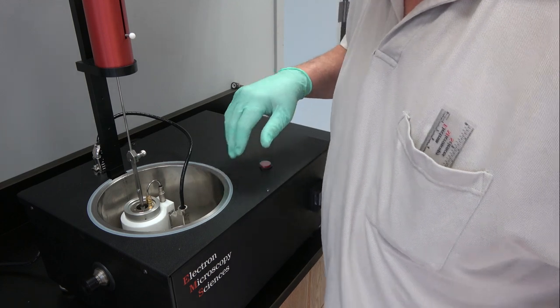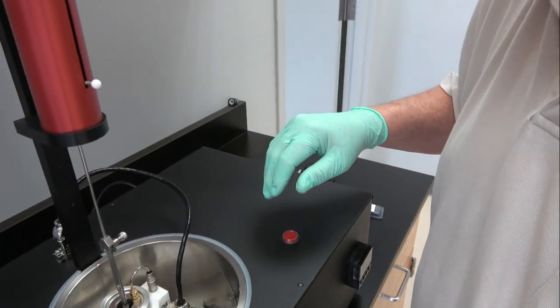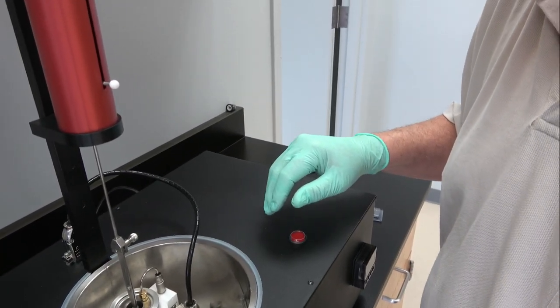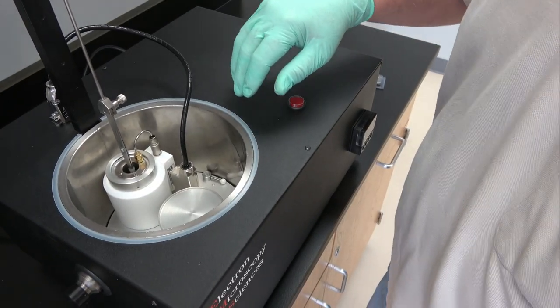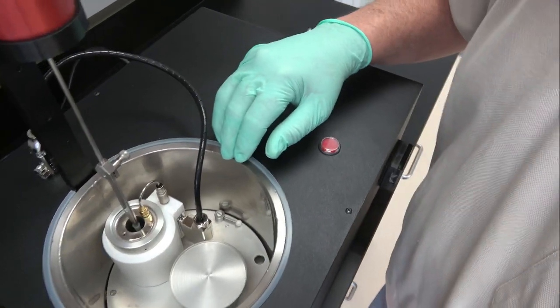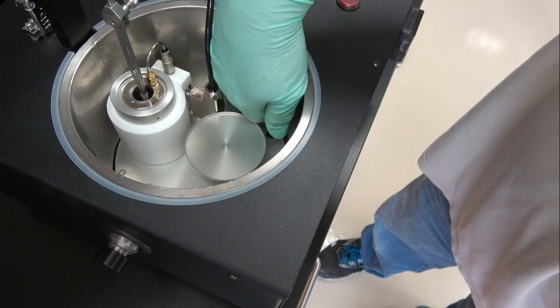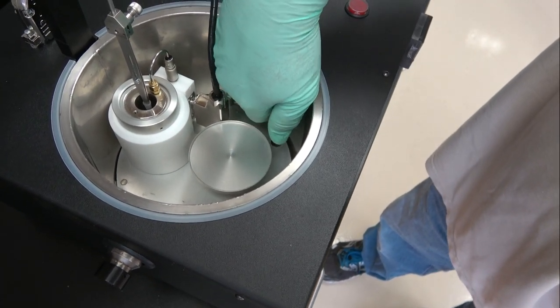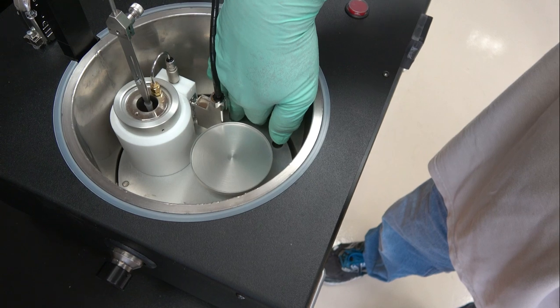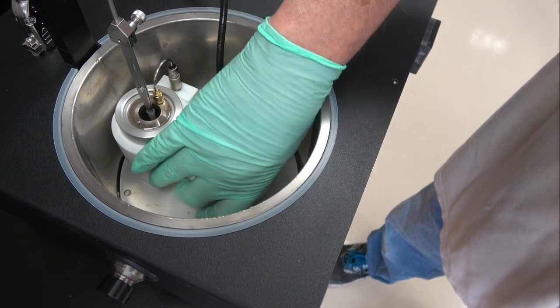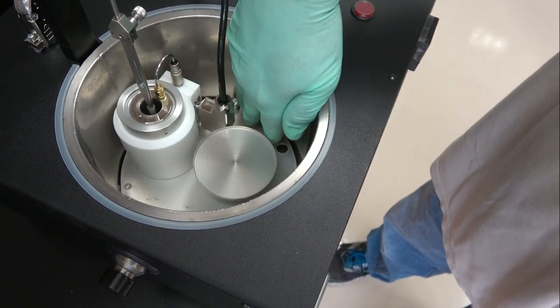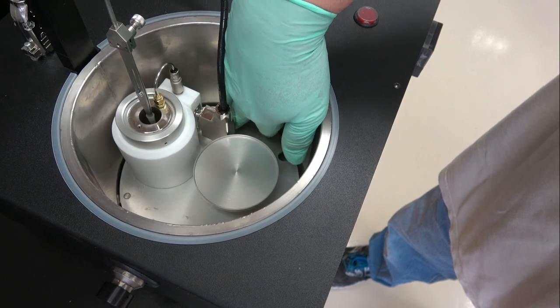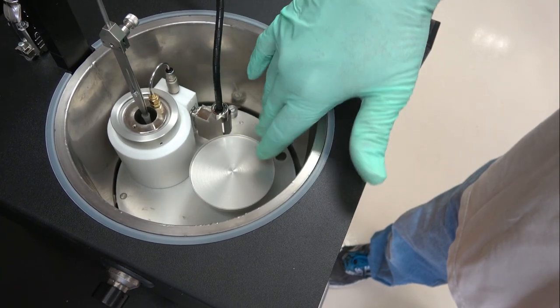Then a little tough to see, I'll try to maneuver the camera so you can see. There is a little locking cam over here which you can maneuver with your fingers or a tool, and that pushes against the wall and locks everything in place.